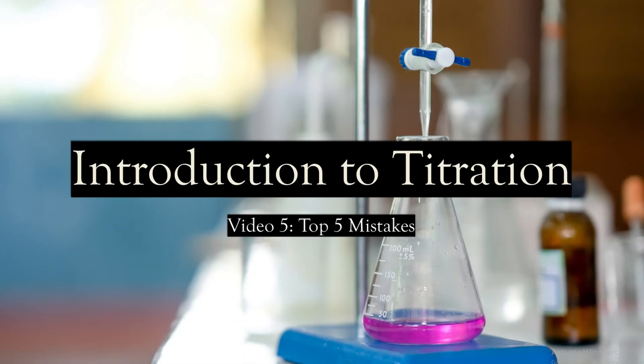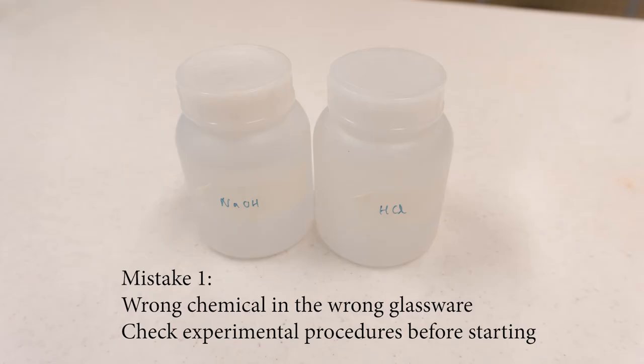In this video, we will be talking about the top 5 mistakes students make in titration. These mistakes are listed in chronological order. Mistake number 1, putting the wrong solution in the wrong glassware.